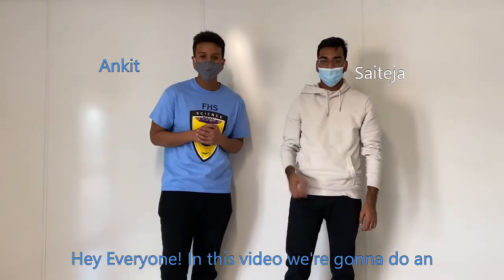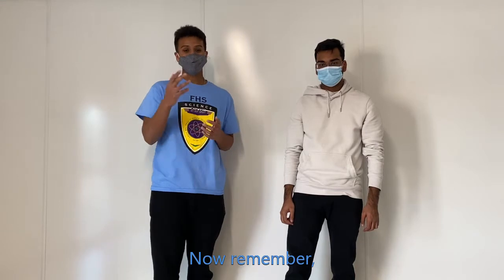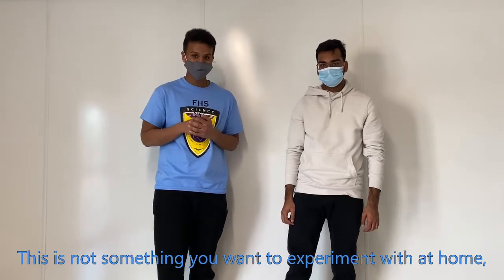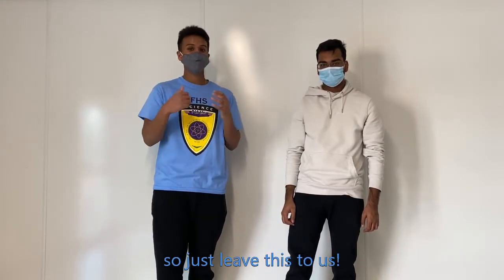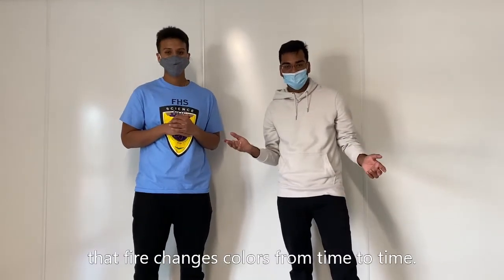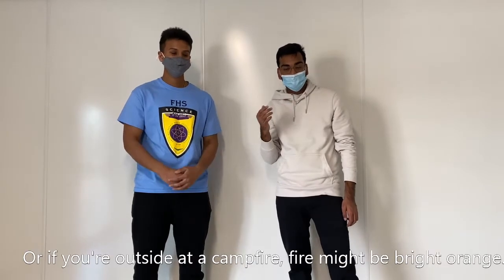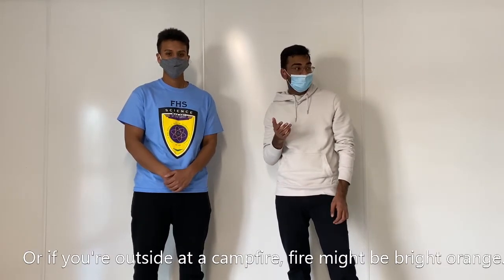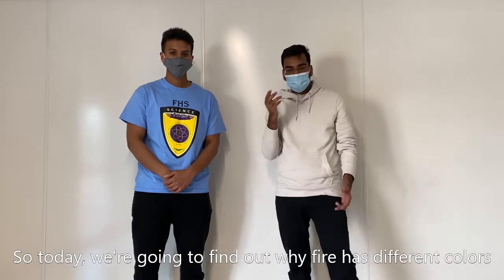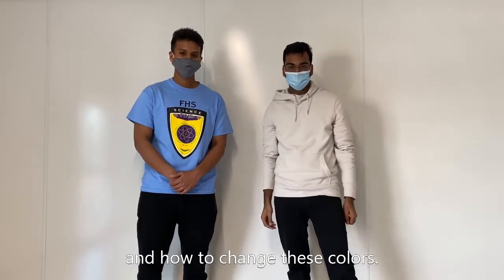Hey everyone, in this video we're going to do an experiment that involves changing the color of fire. Now remember, this is not something you want to experiment with at home, so just leave this to us. Alright, so you guys might notice that fire changes color sometimes. At home, on a gas stove, fire might look blue. Or if you're outside in a campfire, fire might be bright orange. So today we're going to find out why fire has different colors and how to change these colors.